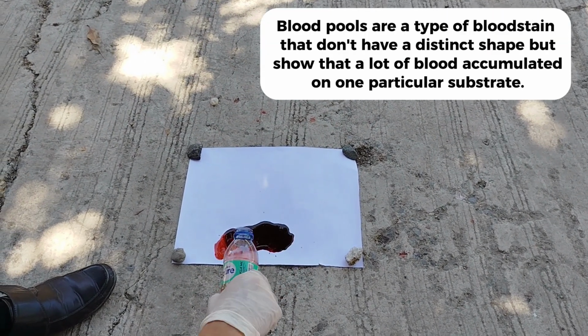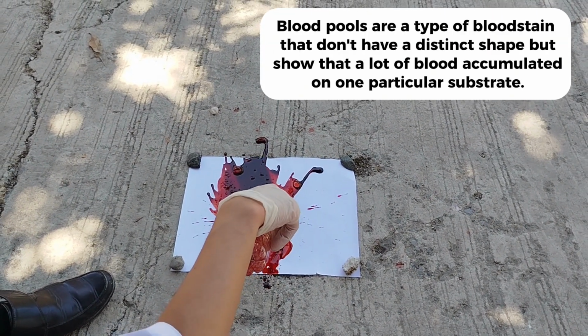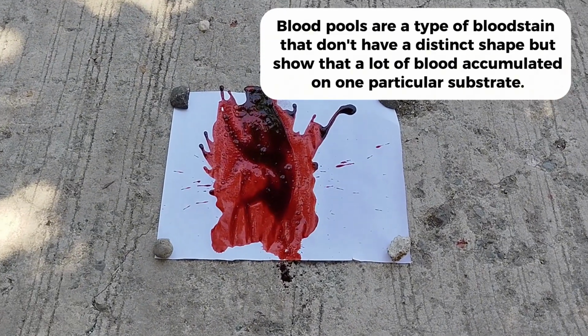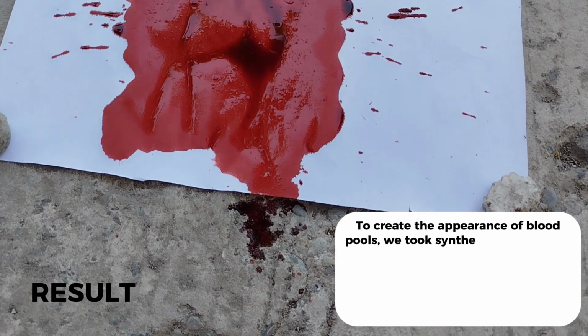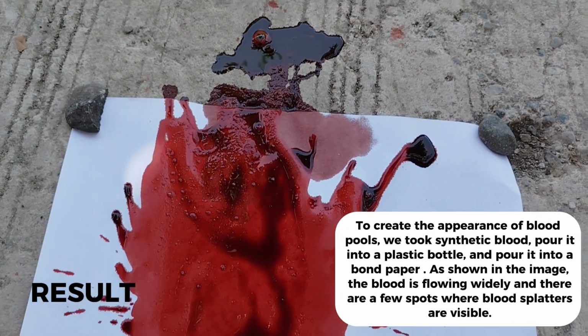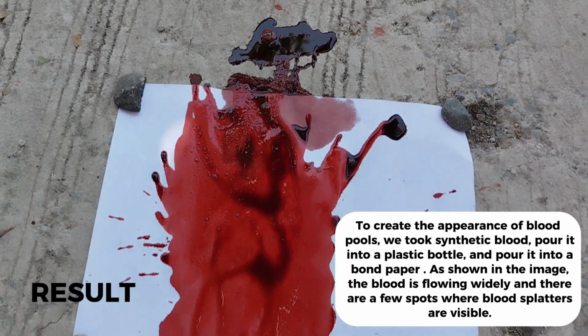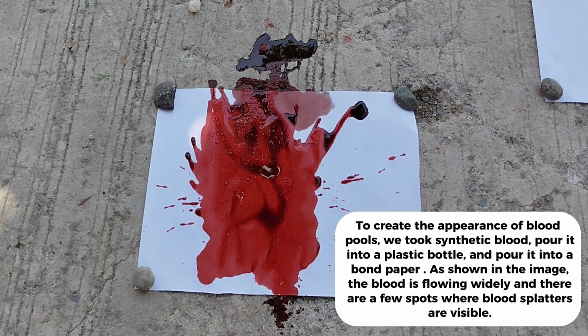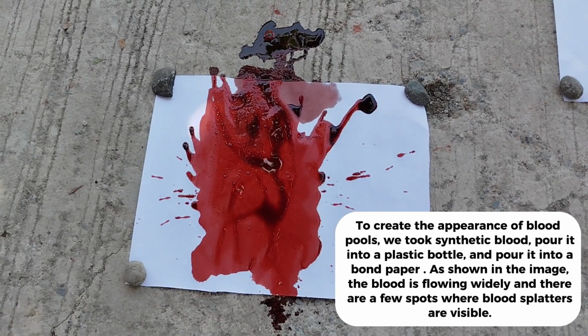Blood pools are a type of bloodstain that don't have a distinct shape but show that a lot of blood accumulated on one particular substrate. To create the appearance of blood pools, we took synthetic blood, poured it into a plastic bottle, and poured it onto a bond paper, as shown in the image. The blood is flowing widely and there are a few spots where blood splatters are visible.